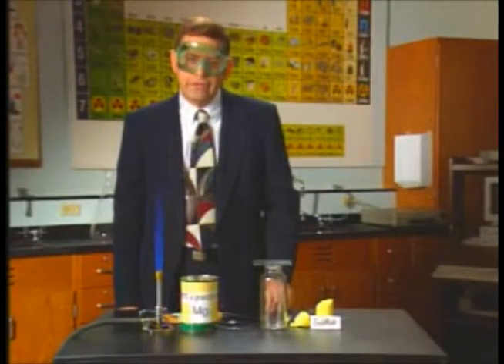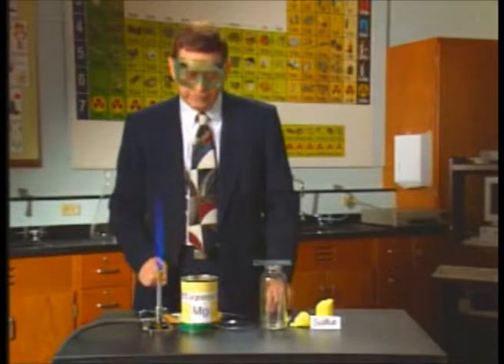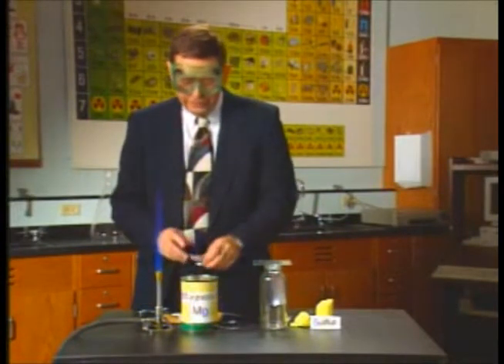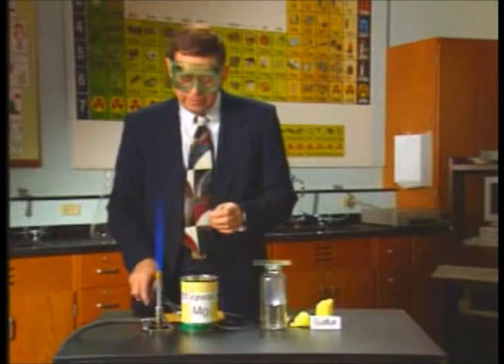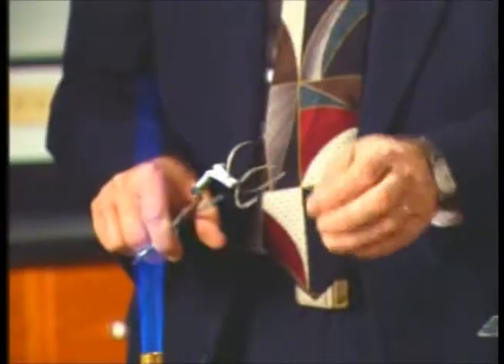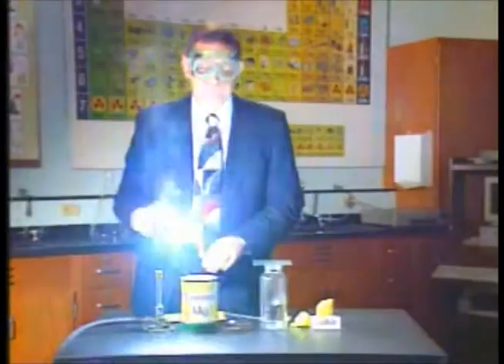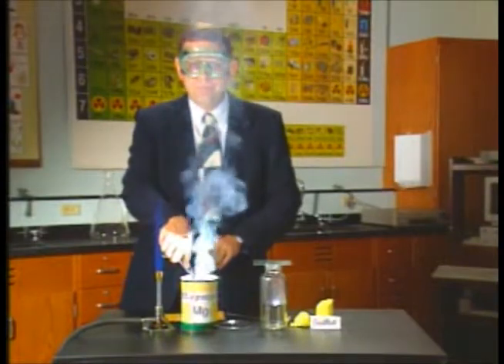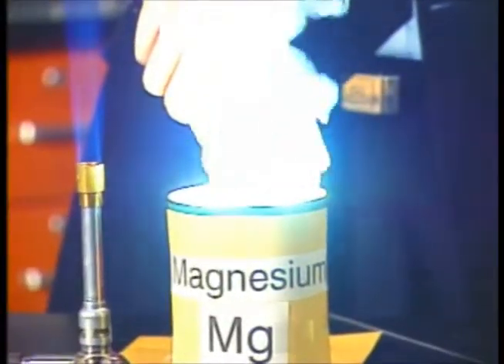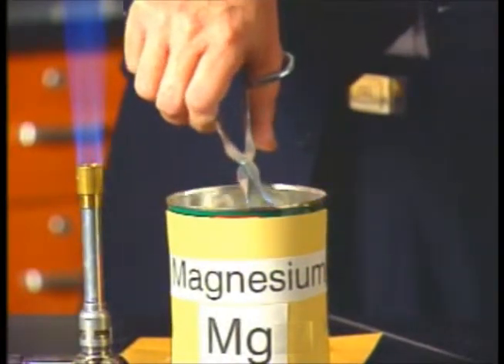To demonstrate the formation of an ionic and a covalent bond and their differing properties, we have a piece of magnesium ribbon. Magnesium ribbon can be burned in a flame. I'm going to lower it into this can to protect our eyes so that we don't look directly at the bright white light. The white product formed is white magnesium oxide.